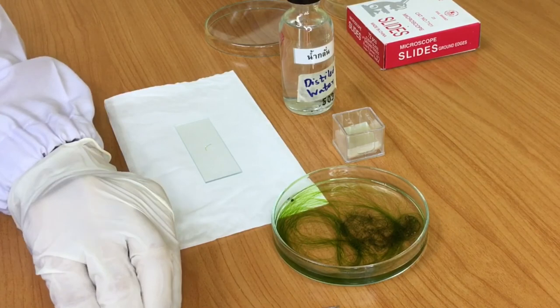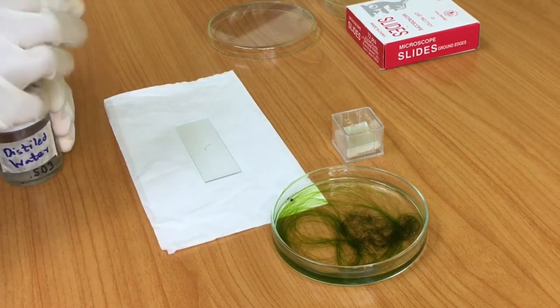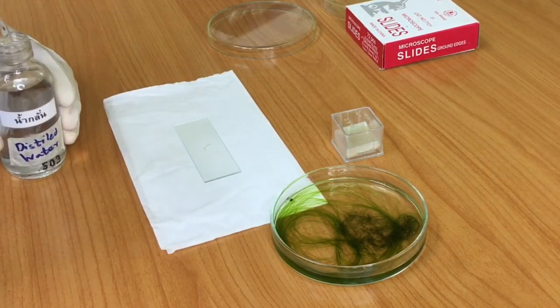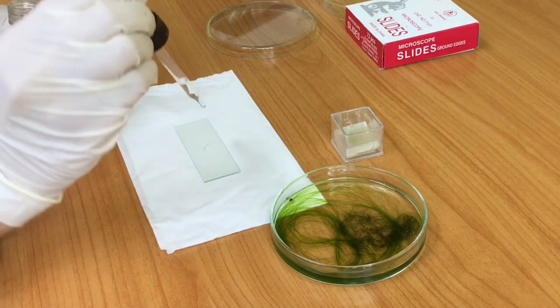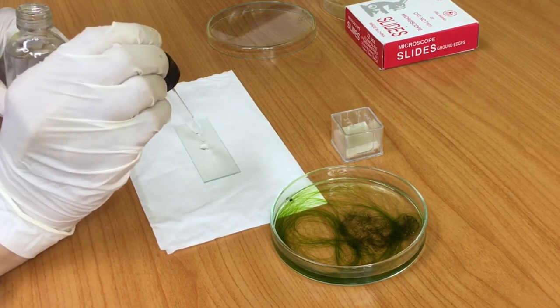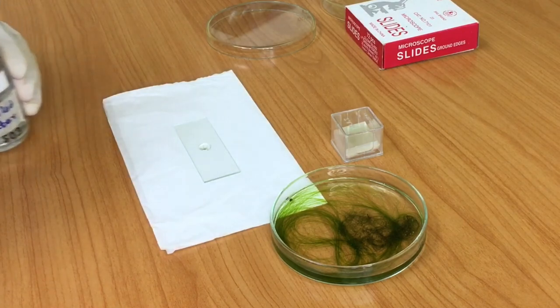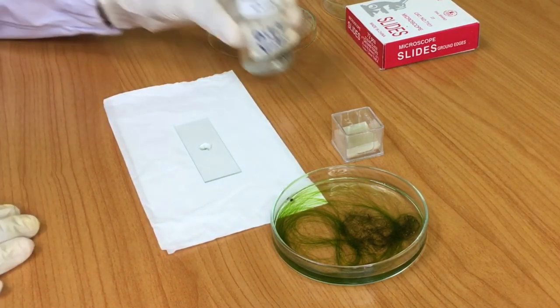First, place the specimen on the slide. This method is only suitable for small specimens.